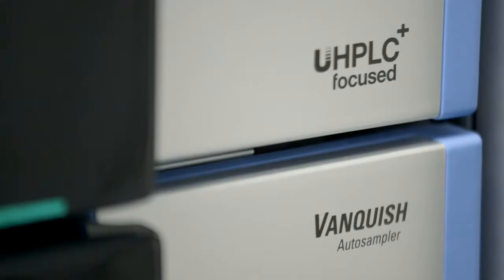Hello and welcome to this application note video demonstrating ultra-fast hydrophilic interaction UHPLC analysis of 2AA-labeled N-glycans from monoclonal antibodies. Our goal was to develop a rapid N-glycan analysis for batch-to-batch comparison of monoclonal antibody glycosylation using UHPLC and fluorescence detection.